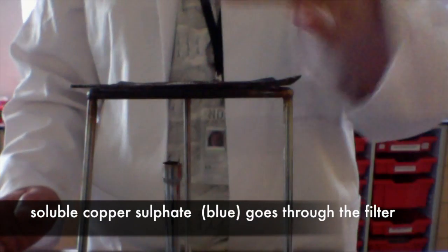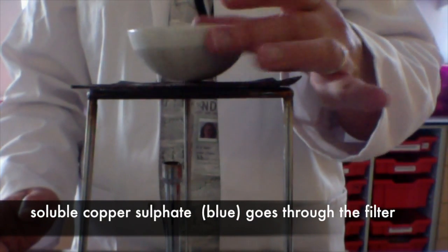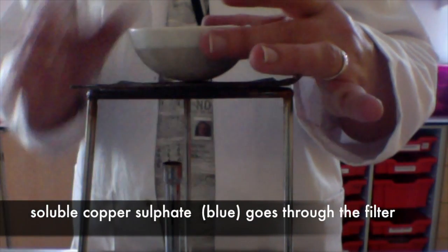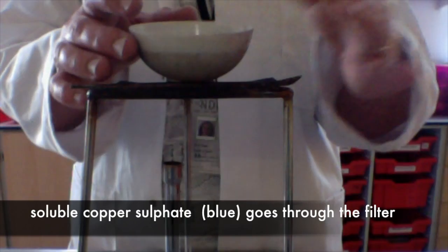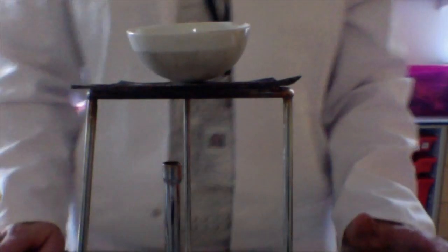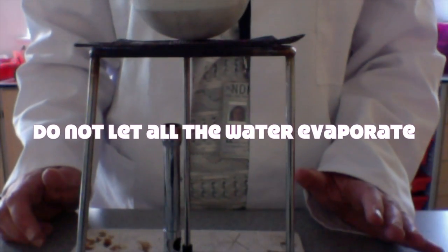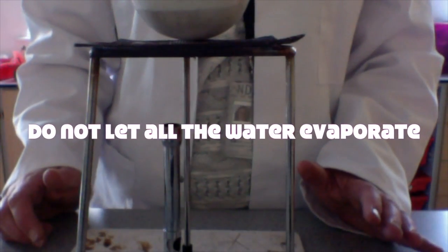Inside is my dissolved salt. So I can now heat this to evaporate the water. I have to be very careful here of a few things. First of all, if it's spitting, you just remove the heat to stop it spitting. You only want to evaporate away about half of the water.